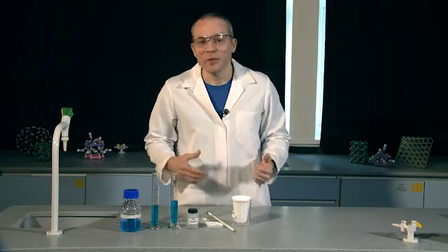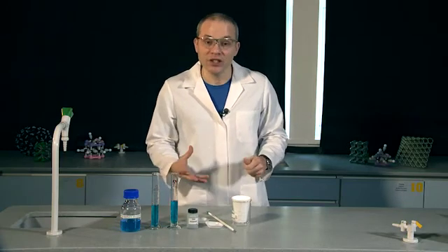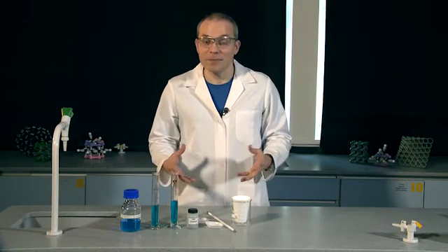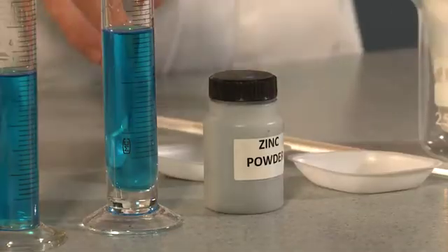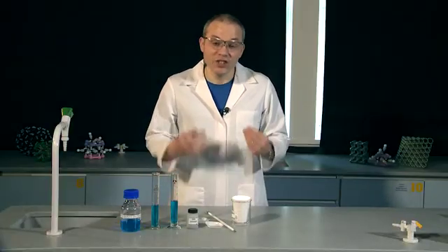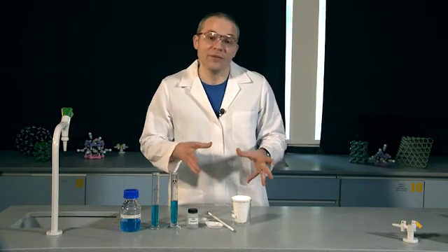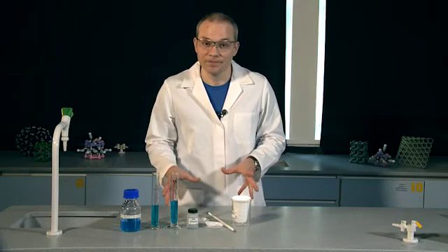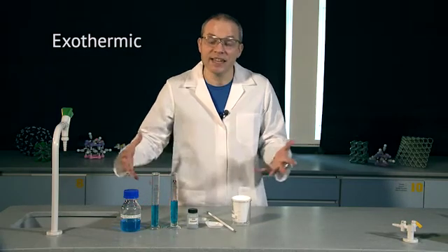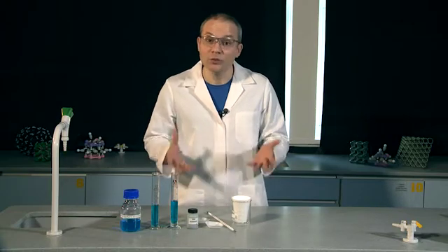In this practical we're going to investigate a variable that affects the temperature change of a reaction that takes place in solution. The reaction we're going to look at is between zinc metal and copper sulphate solution. This reaction is exothermic, so it releases heat energy as it proceeds, and that heat energy will cause the temperature of the solution to rise.